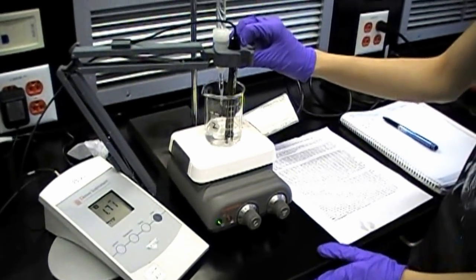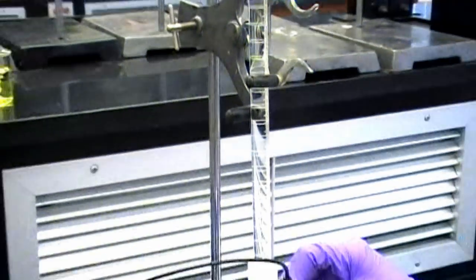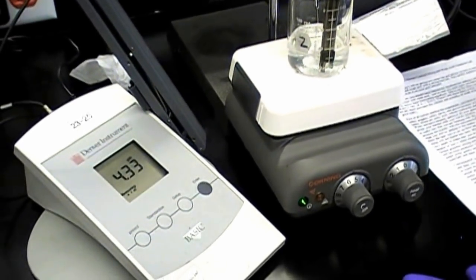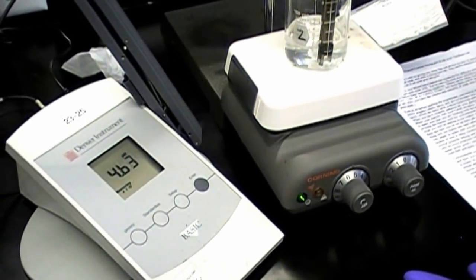Once you have your test run, you can know exactly where you'll need to slow down to ensure you have good data points for your pH curve. It's essential to have accurate data from lab because we'll be using that information to create our pH curve.